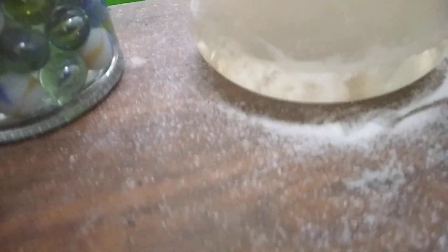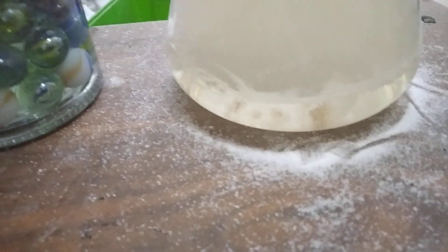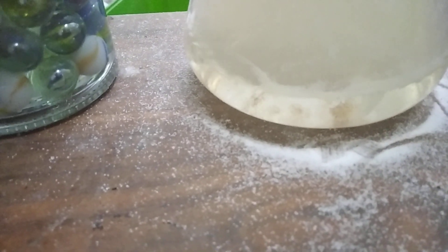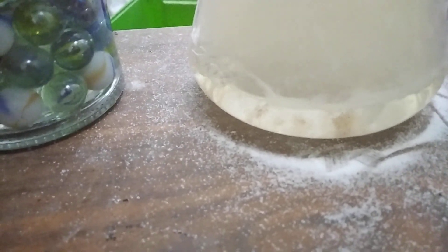You can see this is a little brown. I've run this for more than 30 minutes, which means this seems to be pretty concentrated. I would have to check in a while how concentrated this thing is.